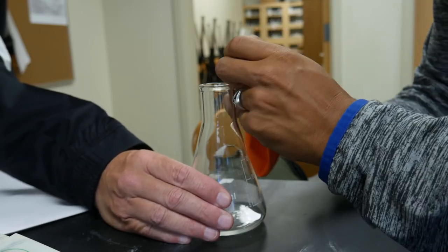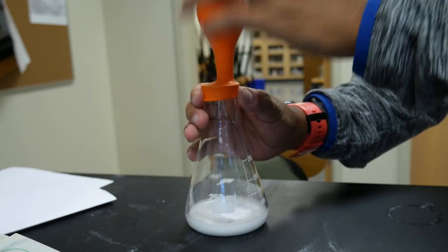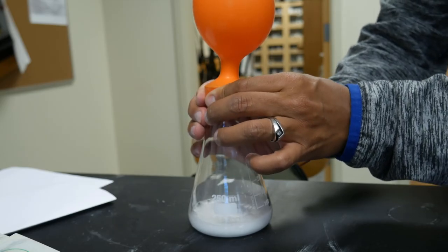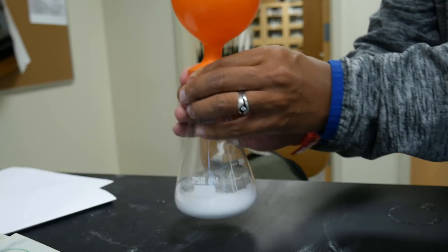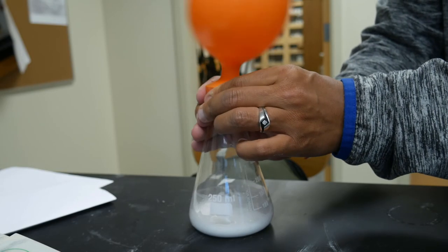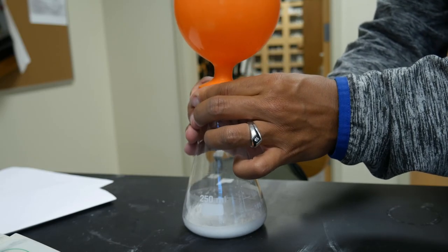We're going to add this balloon over the neck of our flask very carefully and allow the baking soda to fall in and let the reaction take place. For safe keeping, I'm going to hold this balloon with my fingers because it's getting filled with gas and I'm afraid it will fly off. We'll swirl the solution to make sure all the baking soda reacts with the vinegar. If the law of conservation of mass holds true, our mass before and after should be pretty close to the same.